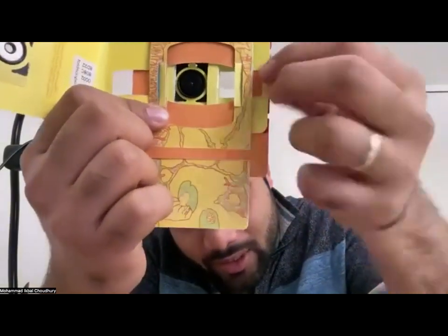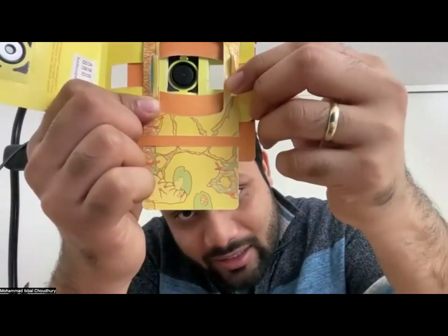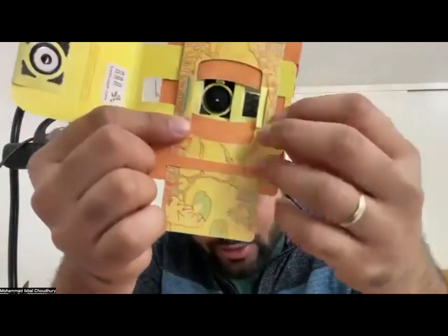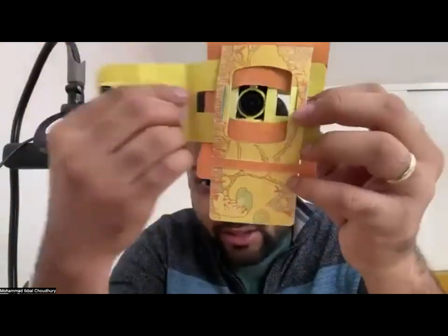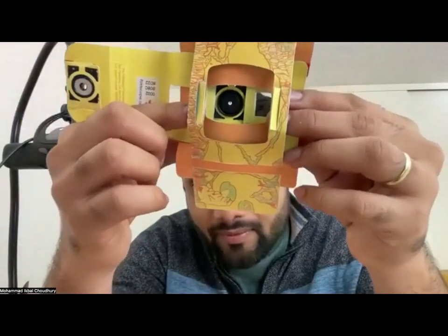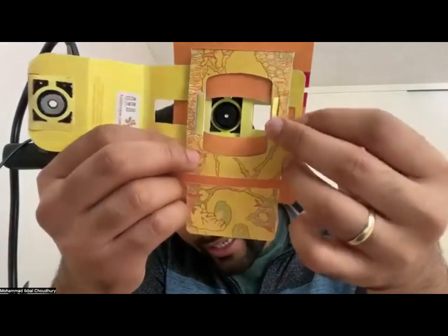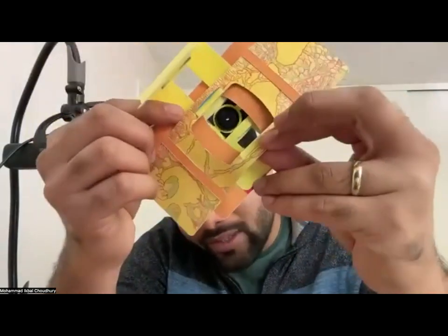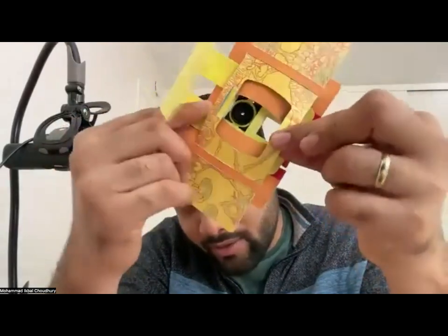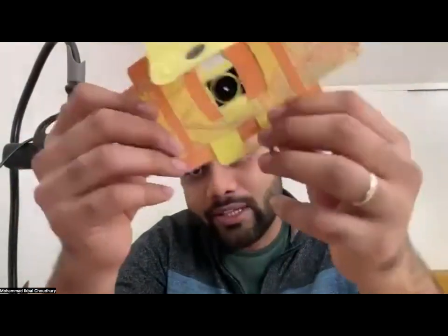You see? Well, I've got the slide in all right. Everything seems to be okay. I just couldn't see that little arrow. Yeah, if you have your slide in all right, then no worries. So the slide should not go in through this. The slide needs to go in through that, like this piece of paper that you have. Oh, I found the arrows. It's underneath that piece of paper. Yes, exactly. So that's where you need to go.